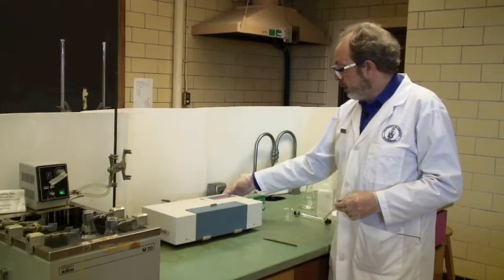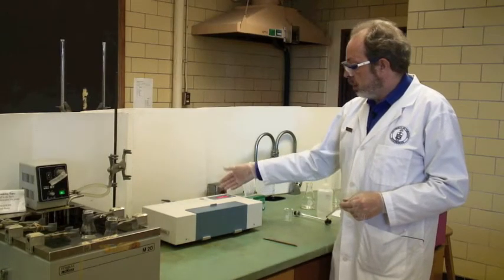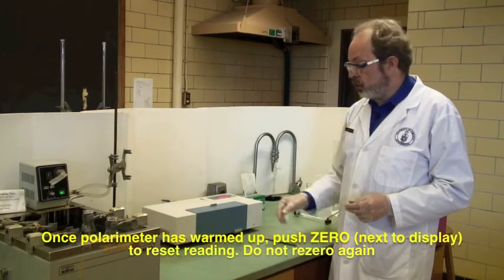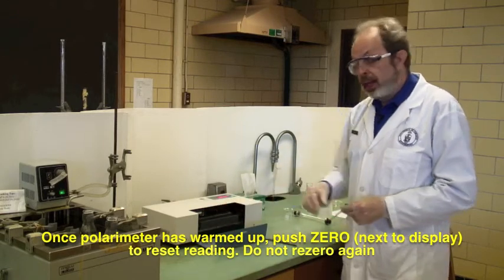This has given some arbitrary reading. So I just push zero and that resets the polarimeter to zero. The sample compartment is right here.